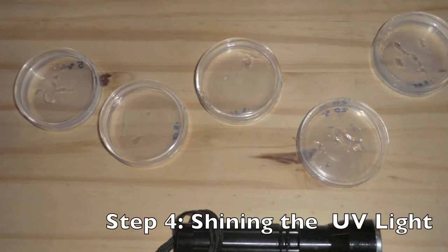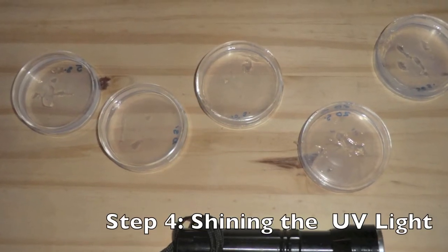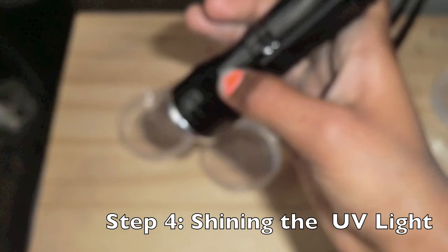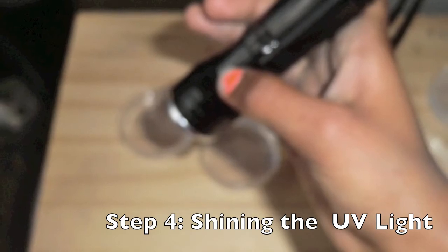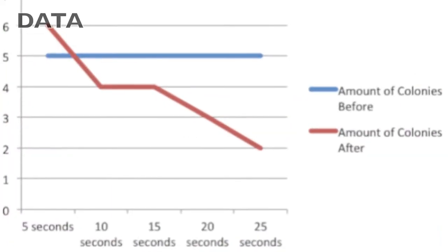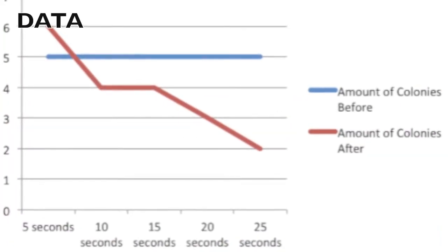After each petri dish had 5 colonies, I shone UV light for different exposures on each petri dish and waited overnight. Here is the data I collected.